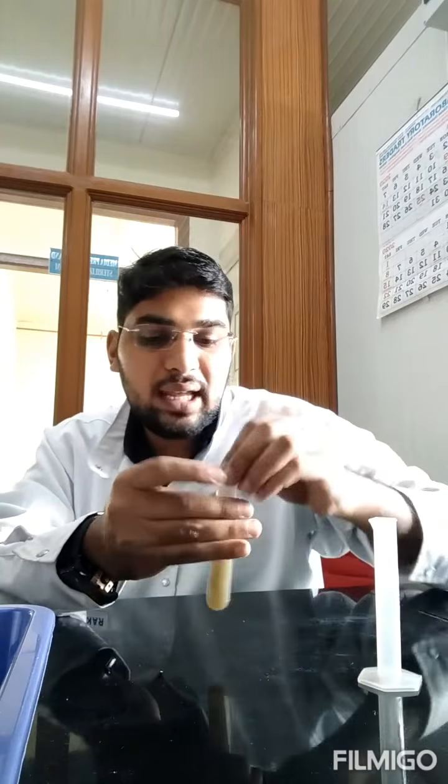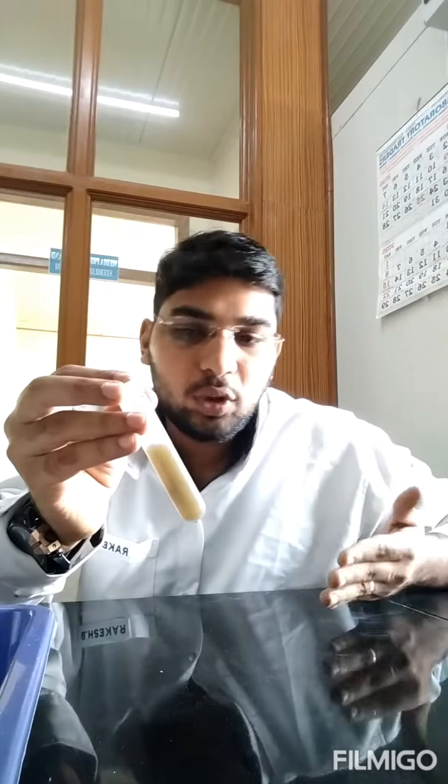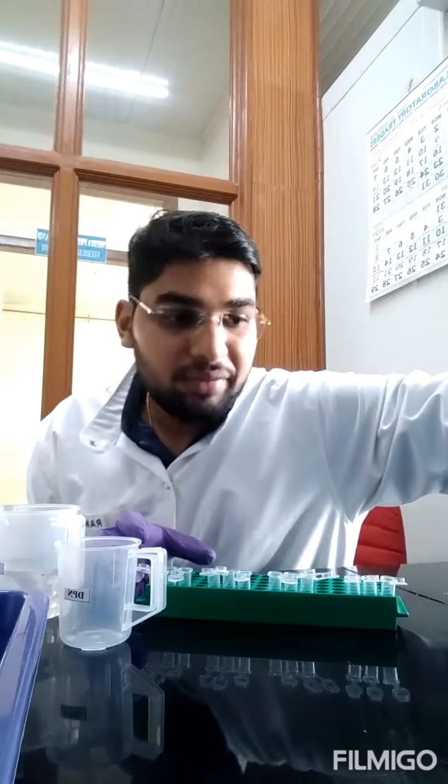So always do it in triplicates whenever you're doing any experiment. Like this, I will do for all the plant samples. After centrifugation, I'll collect the supernatant and then I will show you how to proceed. So now after centrifugation, we have collected the supernatant.